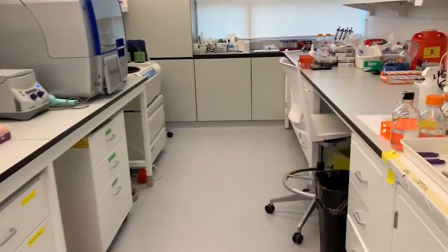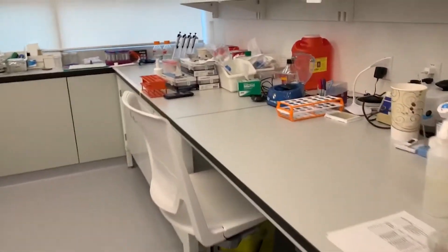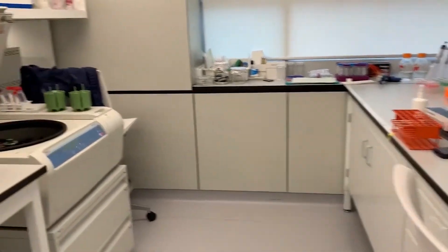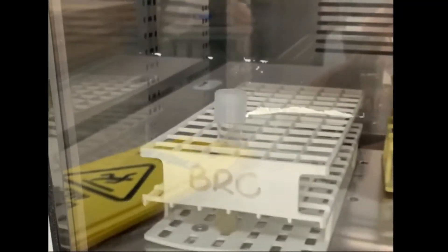This is the SynBioBench, where we perform our genetic engineering work. We clone DNA constructs using E. coli bacteria.